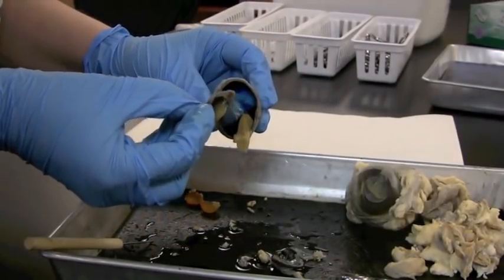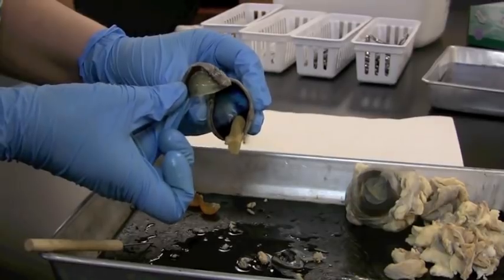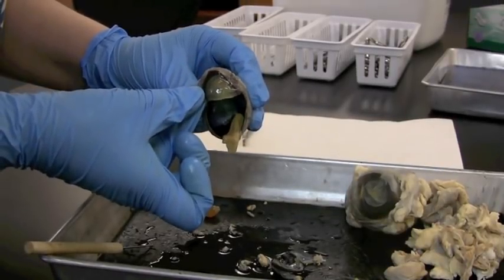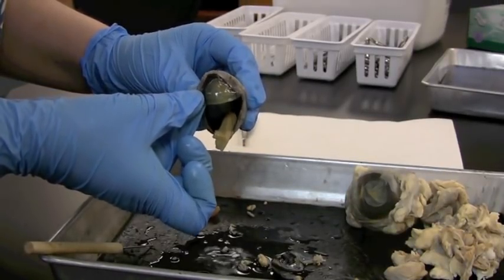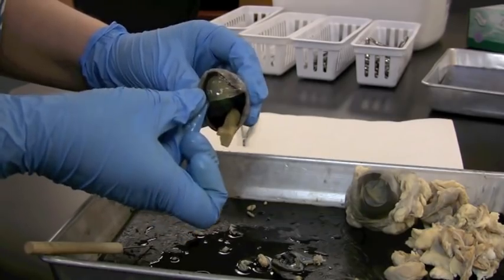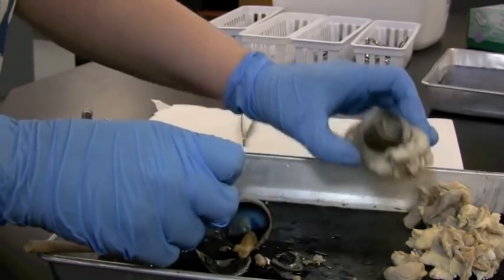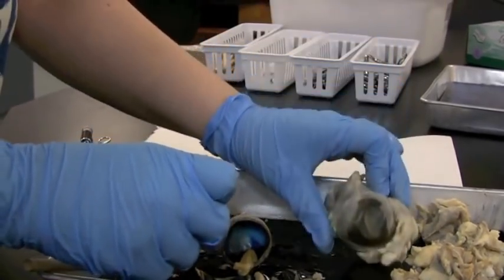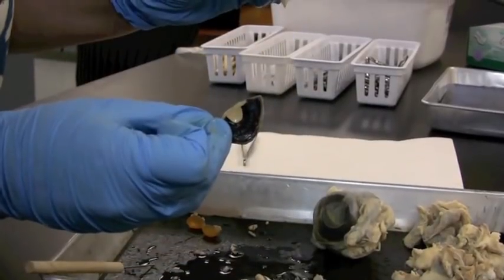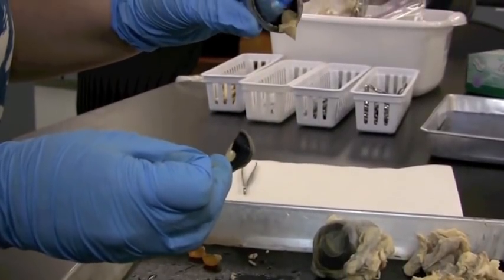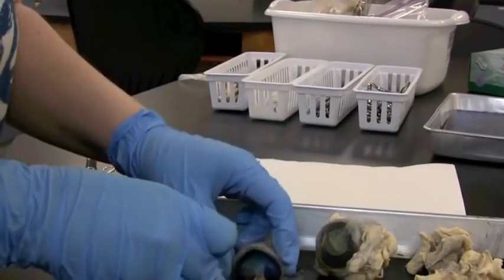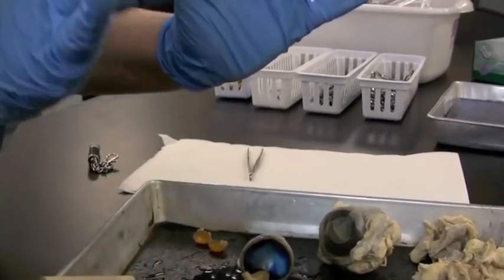That's our basic summary of an eyeball, the parts you can see. We're going to go ahead and say goodbye, wink, wink, this is what we started with, and this is the mess that we end up with. Don't wear nice clothing to an eyeball dissection. And lefty out, righty out.